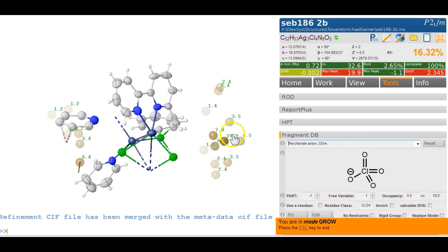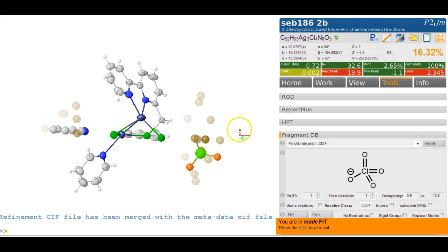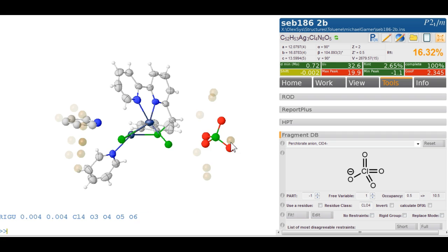It's going to be disordered over a symmetry element, as we've just seen, because it all grows. So we have part -1, and we set the occupancy to 1/2, and we fit it. So we import this. Probably, I wouldn't even nail it on the chlorine, just nail it on the oxygens here. So 1 here, then number 2, and 3 and 4 here, and then let's maybe move this over here. And I think we've done enough work for now. Let's just refine this. I hit escape a few times.